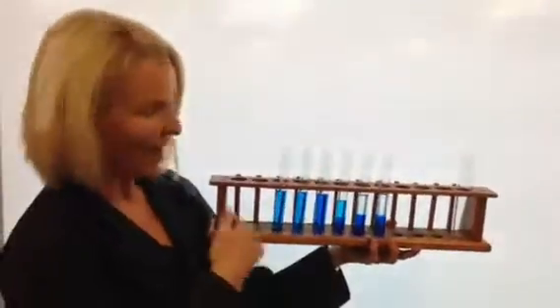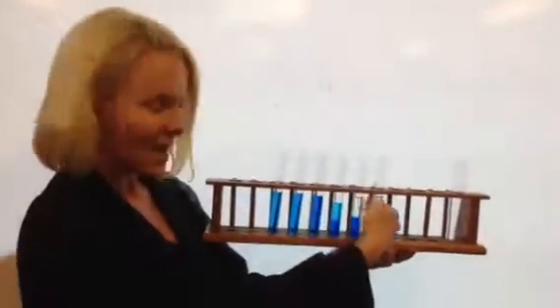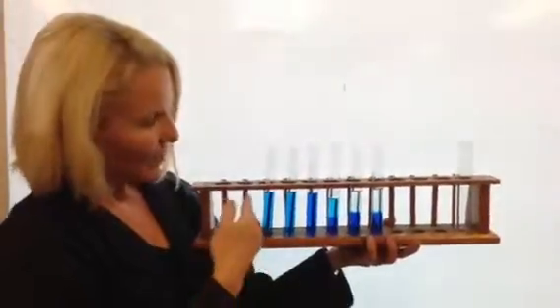We have a series of alcohols mixed with water. The water has had some blue dye added to give it a blue colour so we can distinguish between the water and the alcohol. Starting from the left we have methanol, and then increasing in length of carbon chains.